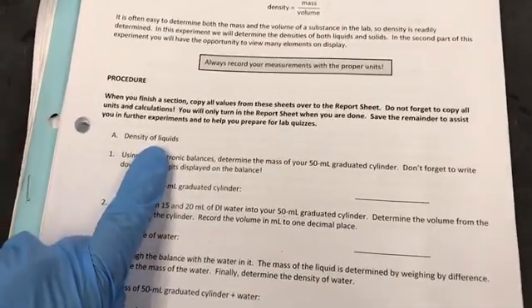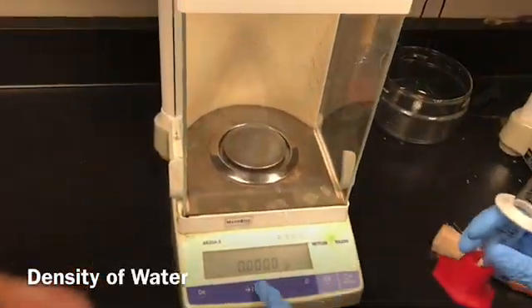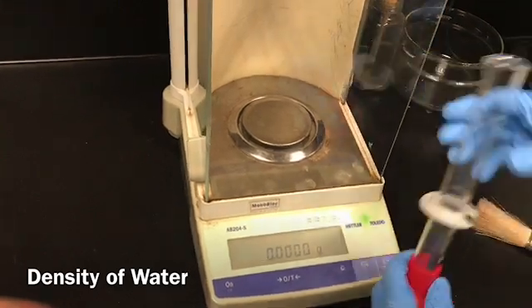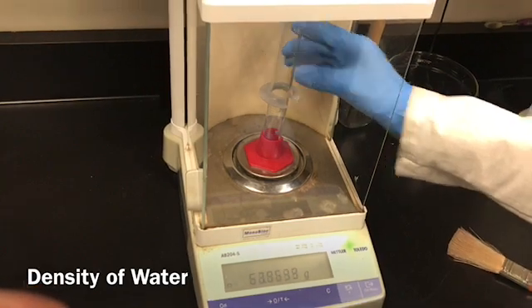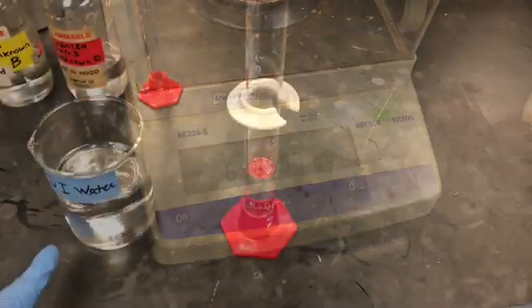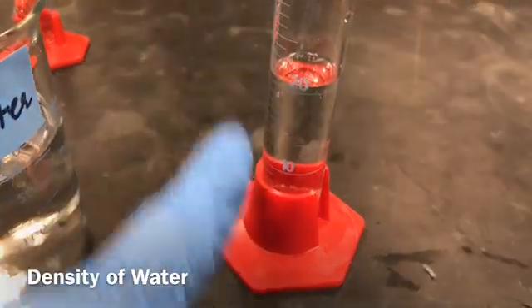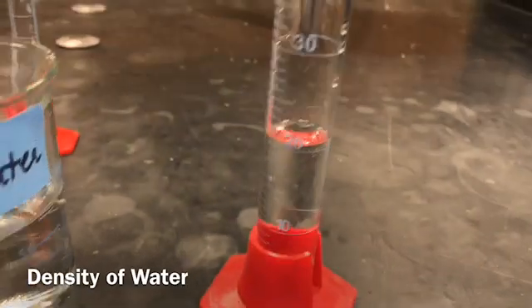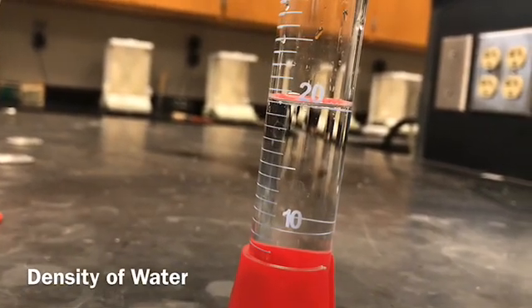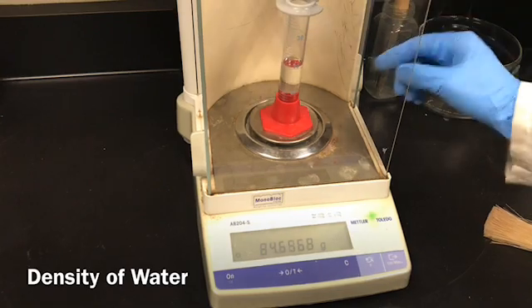Let's start with Part A, density of liquids, and begin with measurements for water. I'm going to record the mass of the 50 milliliter graduated cylinder. I just tared it, so nothing on the balance will add to the mass of the graduated cylinder. I added 15 to 20 milliliters of DI water into the tared 50 milliliter graduated cylinder. Note down the reading at eye level. Now I'm going to take the mass of the graduated cylinder and water using the same volume of water.